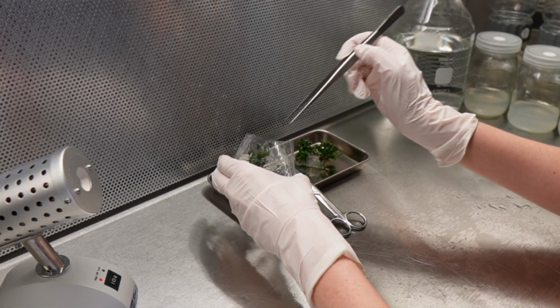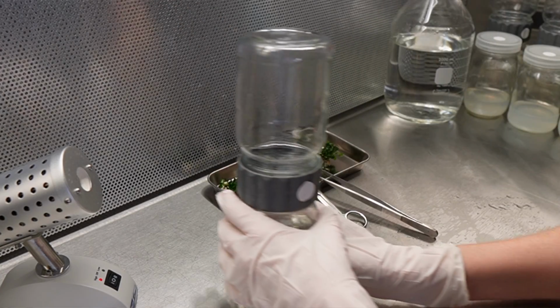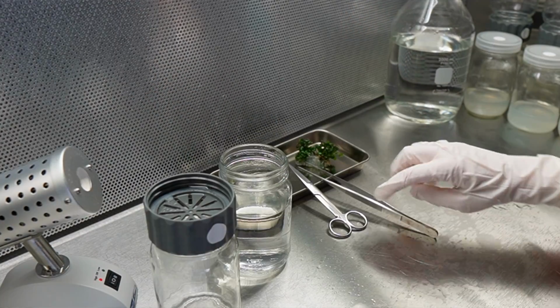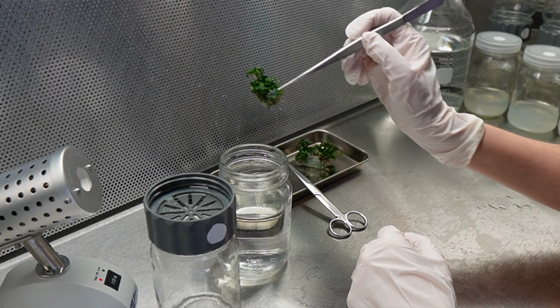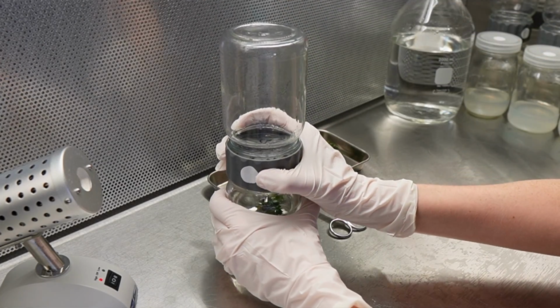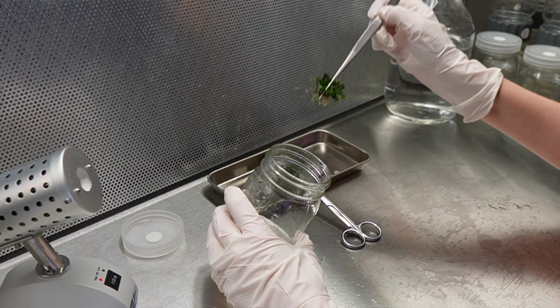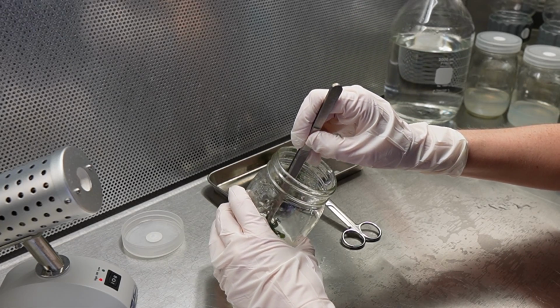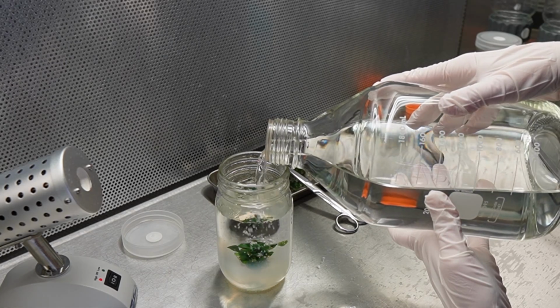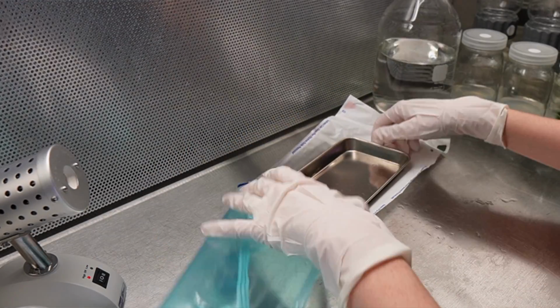When I remove that Bucephalandra, I am super careful not to touch the plants to the outside of the bag. The bags are really difficult to work with, so just be as careful as possible if you're going to try this. I separate the pieces and drop a chunk of that Bucephalandra into the BioCoupler, and then I seal it back up. For that weird protocol that I found on the internet, I open the jar that contains the solid media and press another piece of the Bucephalandra lightly into it so that it stays in place. After that, I add the sterile water, which of course has been autoclaved and cooled to room temperature prior to doing the lab work. I repeat the exact same process for the cardinalis and for the Bacopa.